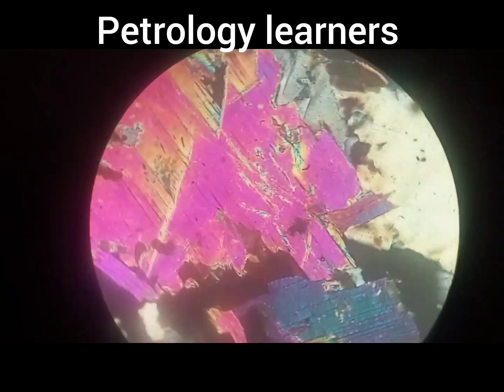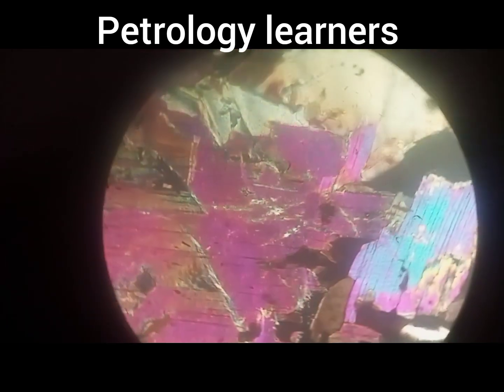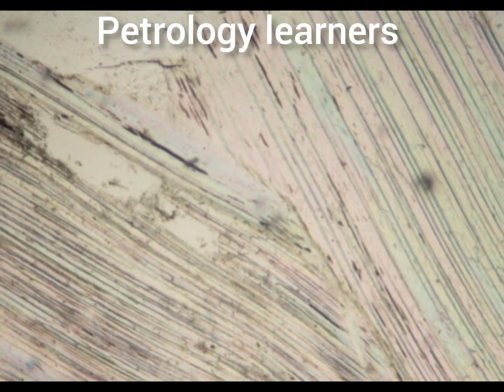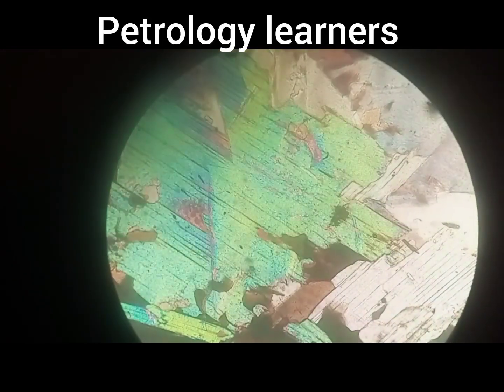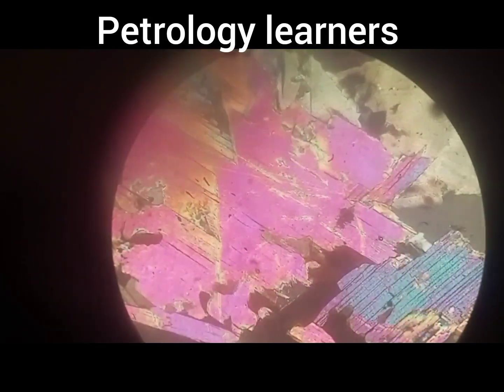Hi friend, I hope you are fine. Today we are going to discuss muscovite — how we identify muscovite in thin section. First of all, muscovite belongs to the phyllosilicate mineral group, which is also known as sheet silicate minerals.